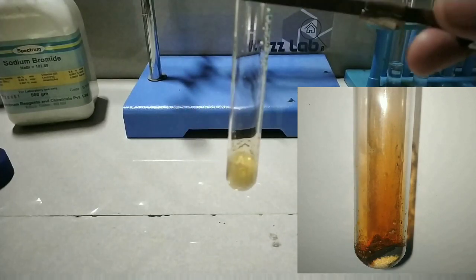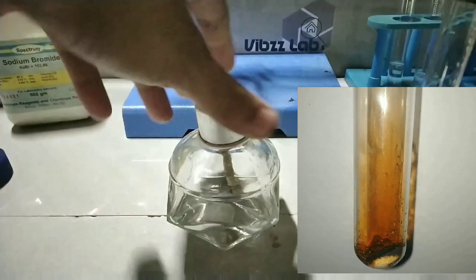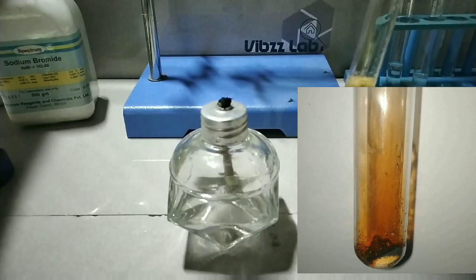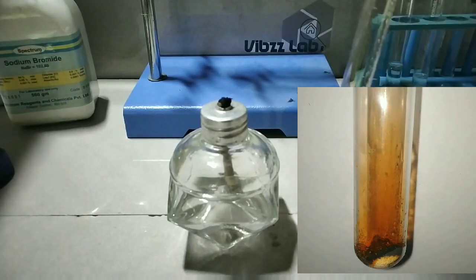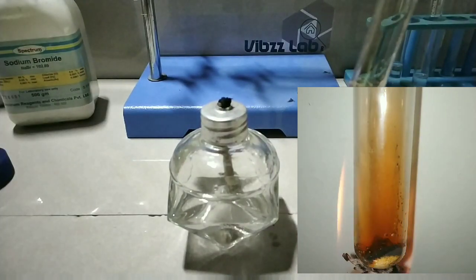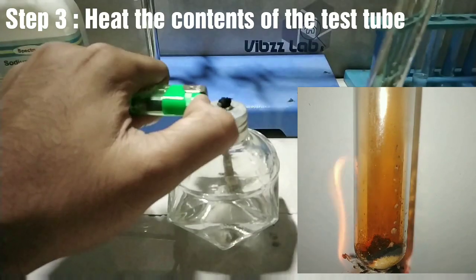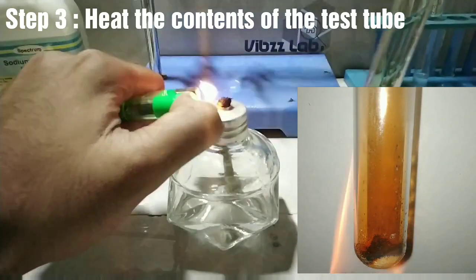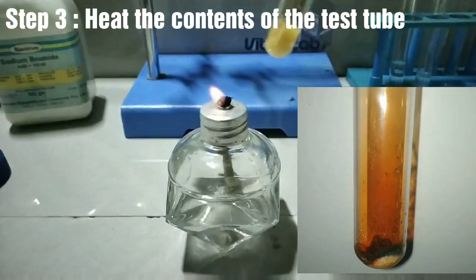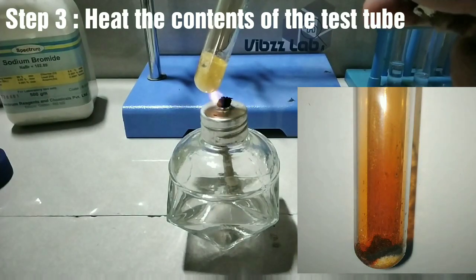In the inset, that is the salt and the manganese dioxide reacting with the sulfuric acid. But just adding sulfuric acid into the salt alone has not yet produced much of a reaction. Now we are heating the test tube and observing the reaction.